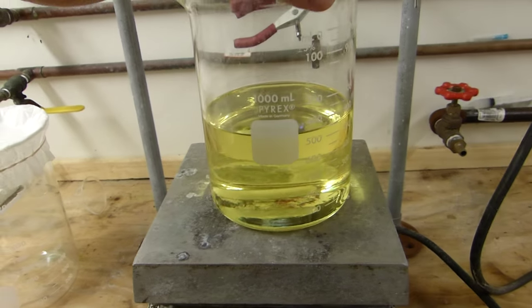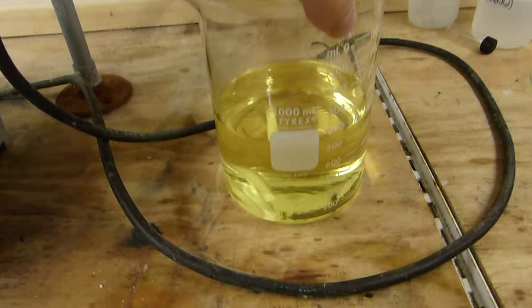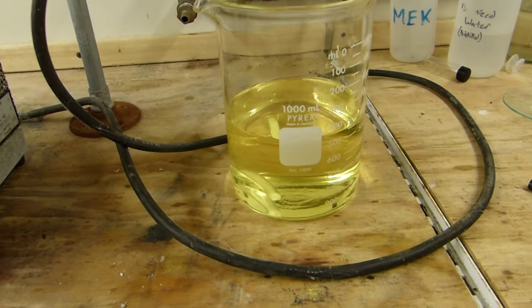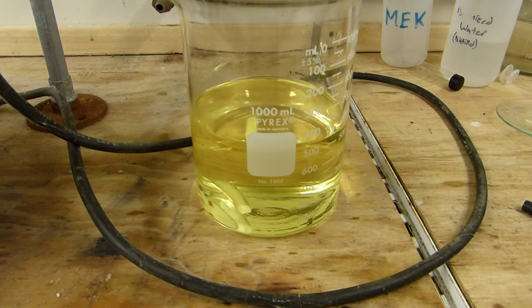Anyway, I'm just going to leave this off the hot plate so it cools down a little quicker in the fume hood, in the lab. I'll cover it with a big old watch glass which I'll retrieve in a second and then we can go ahead and recover the sulfur.